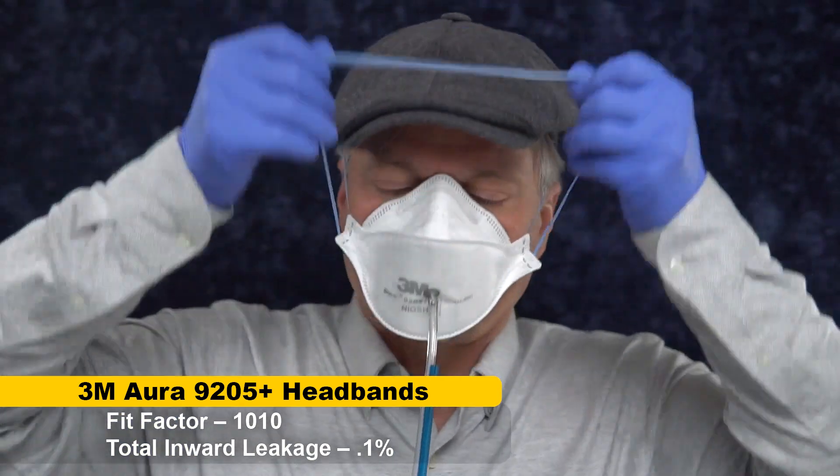I am using an N100 test on these N95s. Normally, with an N95 test that uses fat particles that can't go through the mask, the fit test maxes out at 200. I don't know how they count the N100 tests when you fit test an N95 and it comes out to 1,000 — it's a really well-performing mask.